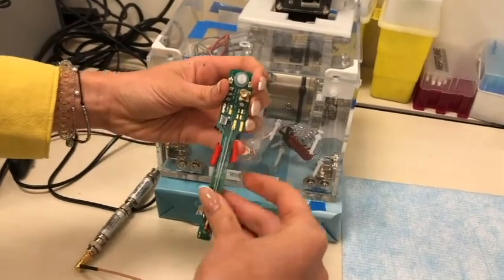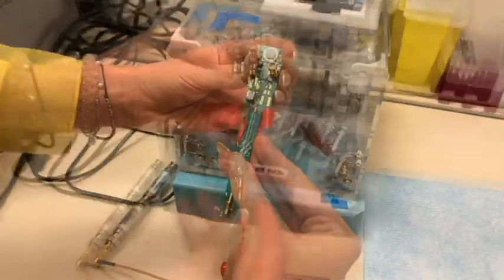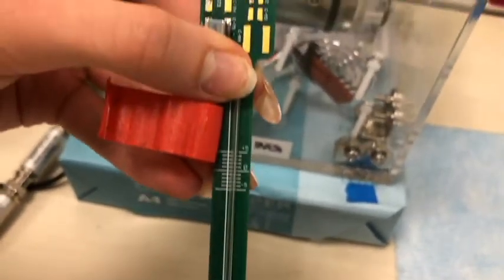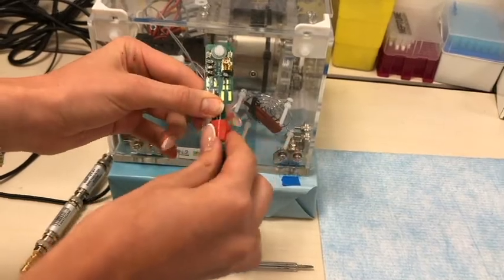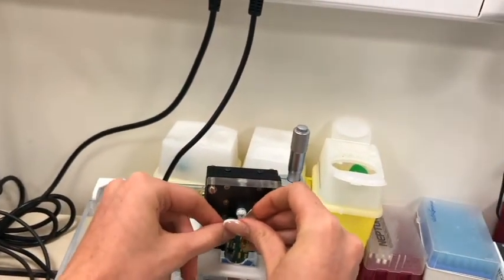Lastly, we put the capillary tube in a probe in which the sample side is placed downward. Then it is inserted in the NMR system. Firstly, we should turn on the machine 30 minutes before acquisition to stabilize the temperature to 30 degrees.